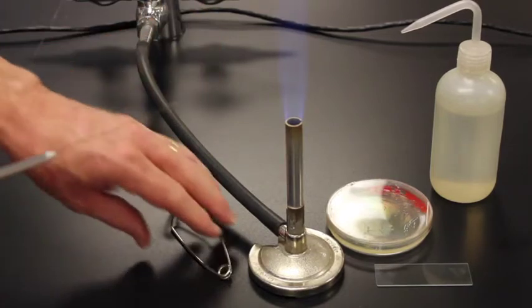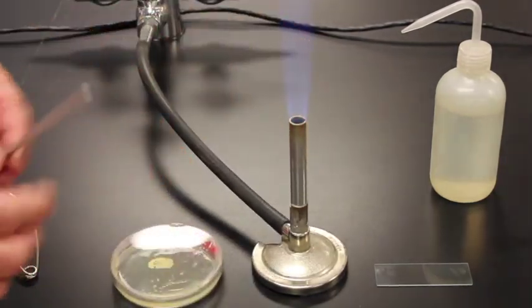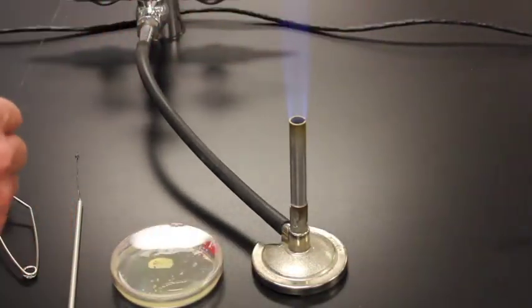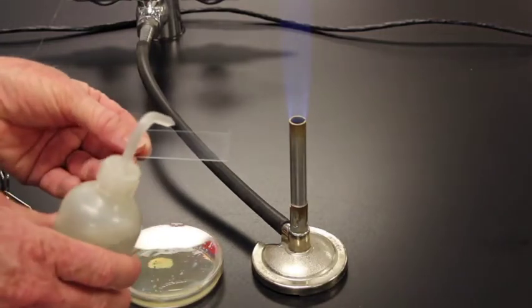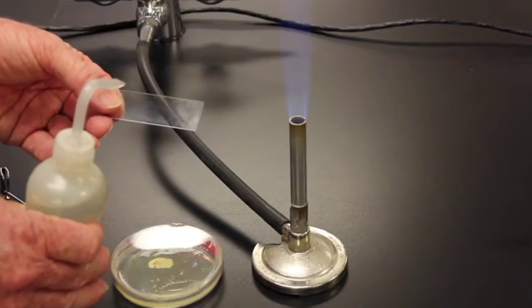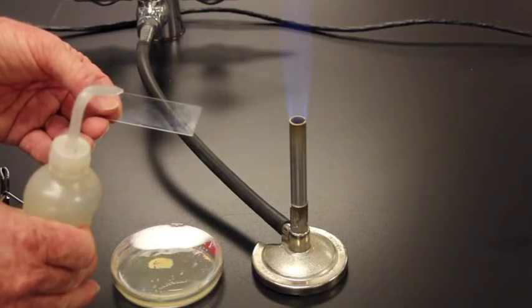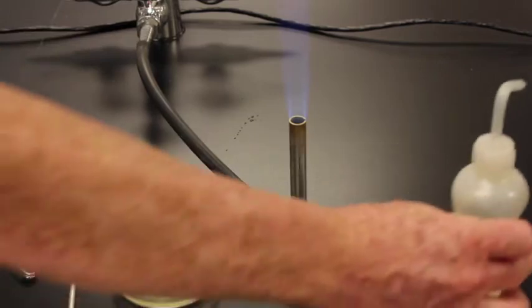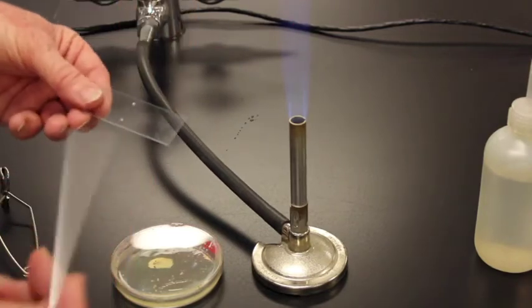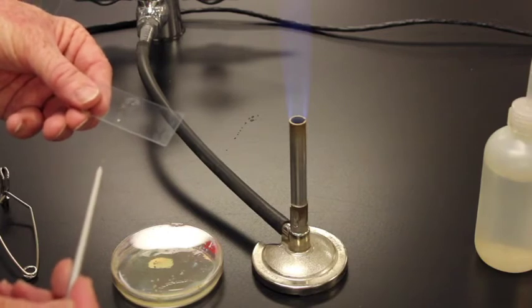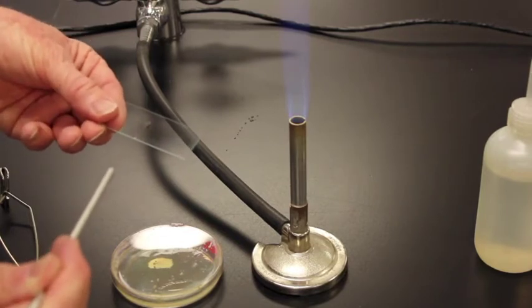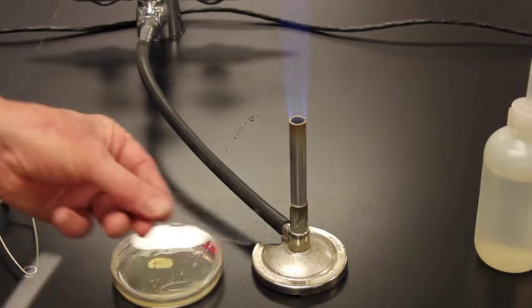So there's bacteria everywhere. Because there's bacteria everywhere, we want to make sure that we heat that loop correctly. Now what I want to do before I heat my loop is that I want to basically take my slide and get a nice drop of water. For this, when we spread it out, we want a teeny tiny drop. And sometimes this is hard to get a teeny tiny drop on here. So I'll push that up. And we can see that I shot a drop on there, but there's two or three tiny drops on here. I'm going to flame my loop again. And I'm actually going to bring this water together because you saw how that sizzled on there. So we'll bring this water together here. So right now there's nothing on it, but we do want all our water on there. So you want a tiny drop of water. You want it spread out like that.